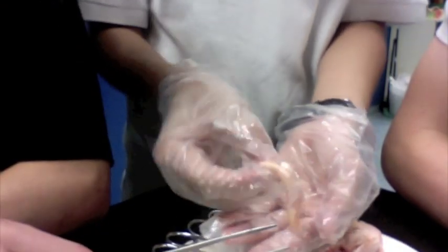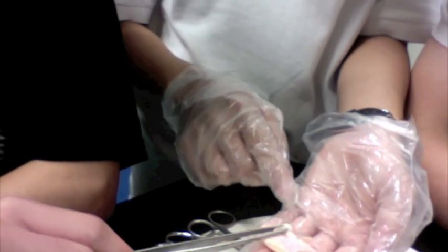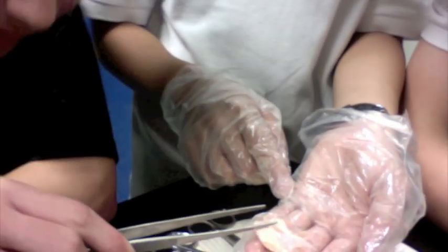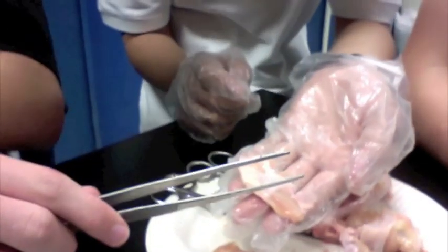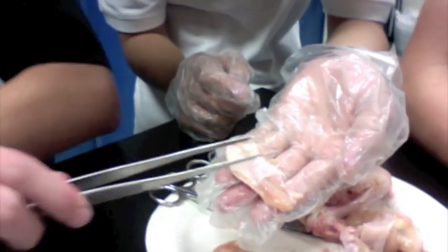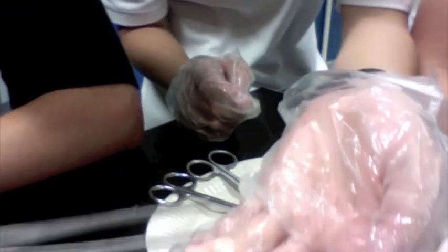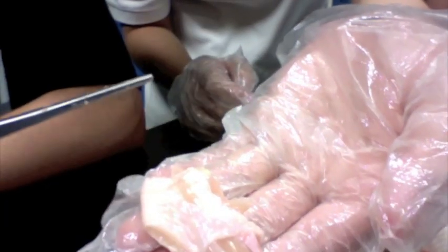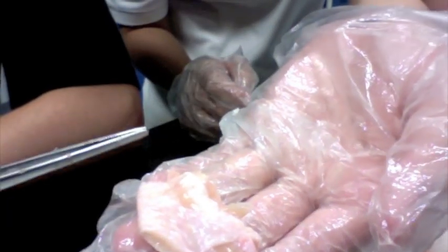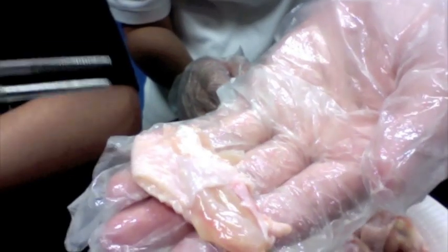Now it's connective tissue. The connective tissue is right here — this white line right here. The connective tissue is connecting the muscle, right here, to the skin.